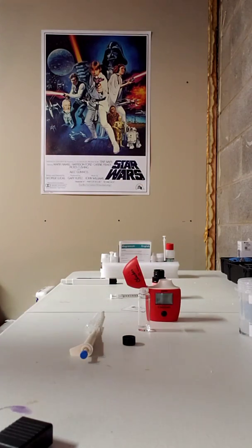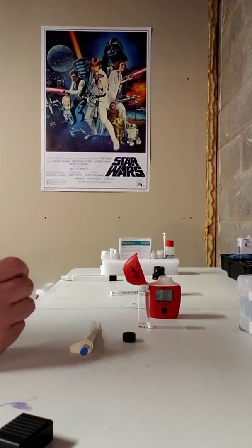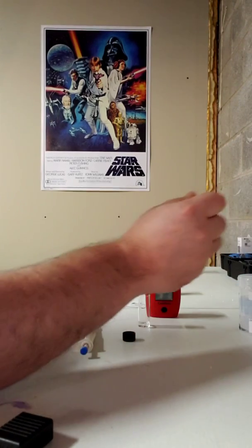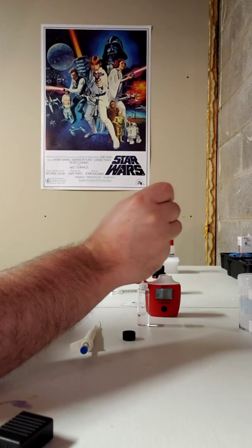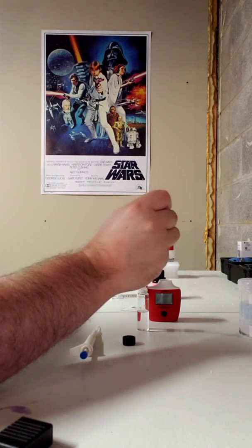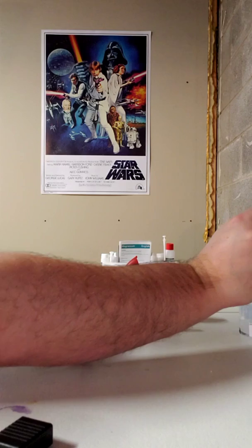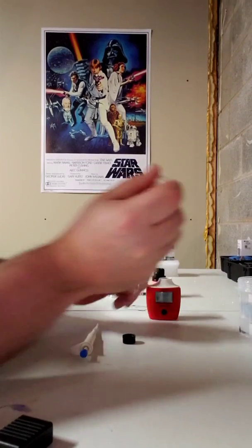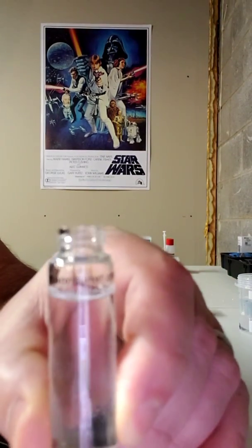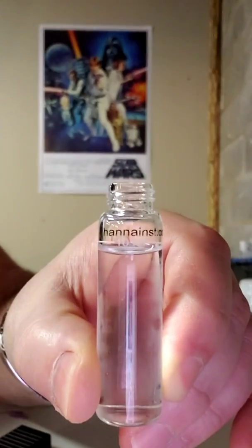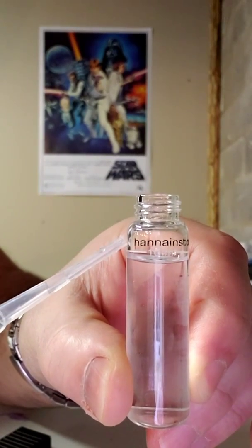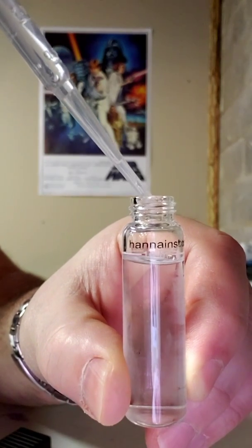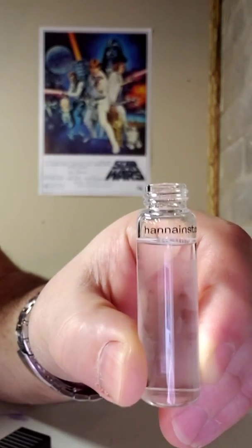Next, they tell you to take and fill to the white line with your water, your clean water, the RODI water. So I'm going to take my little pipette here and fill this guy all the way to the white line. So there is going to be the little curve of the bubble, I believe it's called a meniscus, something like that, at the bottom here, where the water will create a little curve. Now, they tell you to make the bottom of the curve equal with the white line. So it looks like I need to add a few more drops here. And there you go.